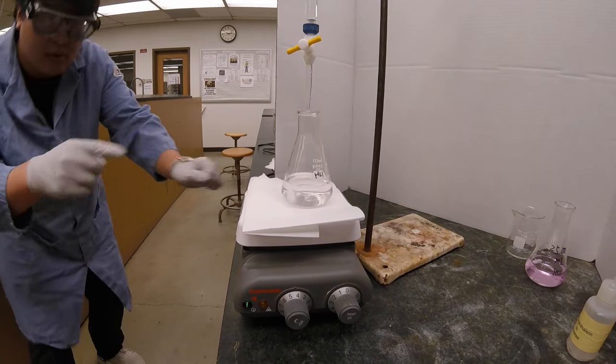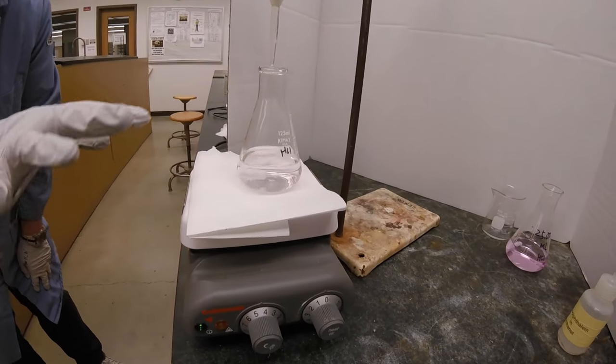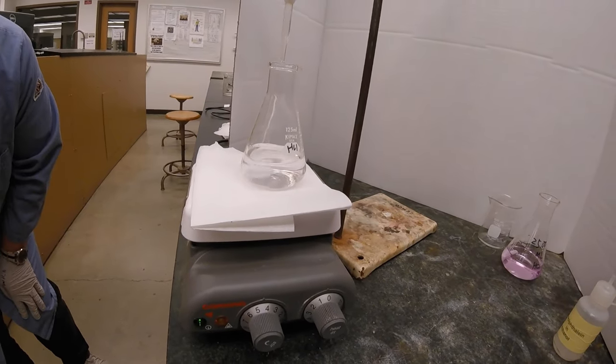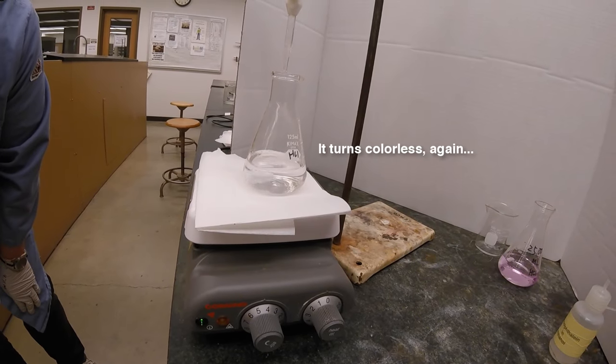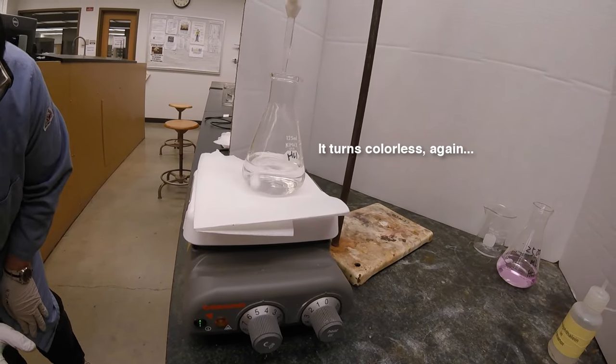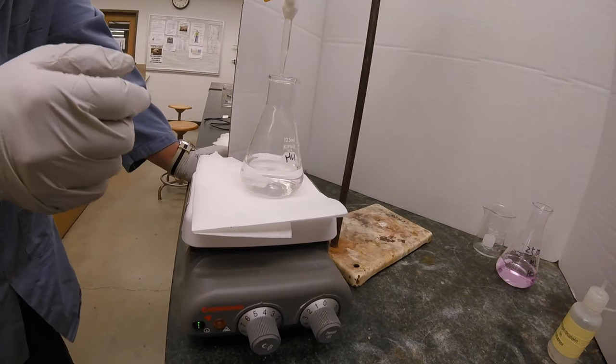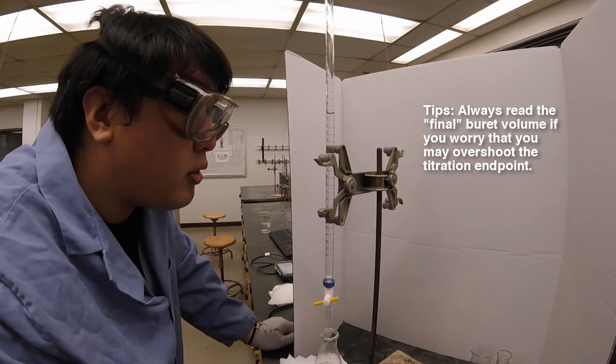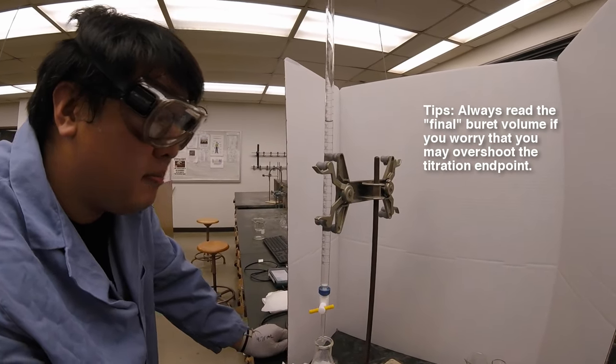That's it. As you can see, it's very hard to tell, but if you have a white background, it's very slightly pink, and it's going to disappear real soon. It kind of just disappeared. Now we'll do one more. Can you read it first? Right now, the volume is 30.19 milliliters.